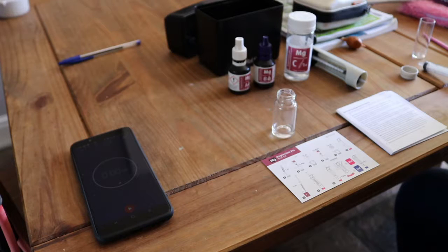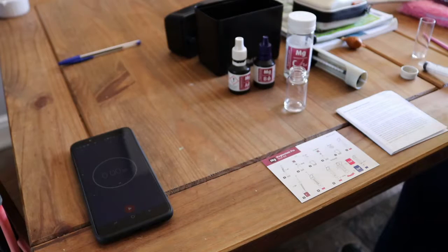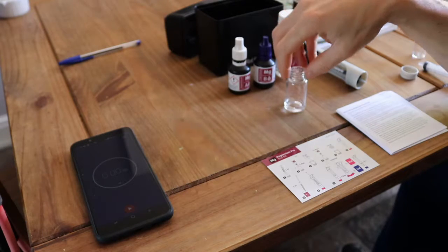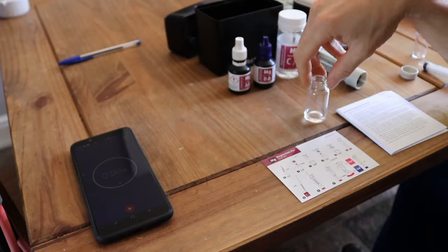Red Sea have got a 7-year-old video on their channel. There's a couple of other guys that have also done some videos on the Magnesium test kit, but they don't all cover the issues that I've had with this. So if you're here, you might be in the same boat that I was. So I've done a video, because hopefully this will help someone that has just bought them. Maybe you're struggling, or you think you might be doing them wrong.